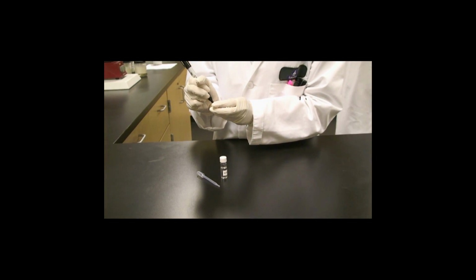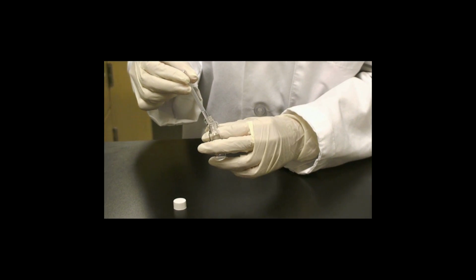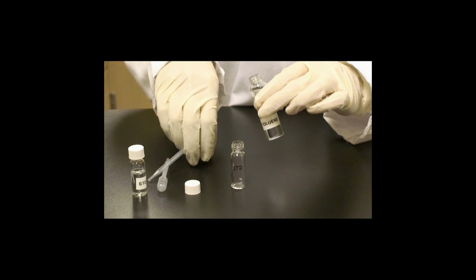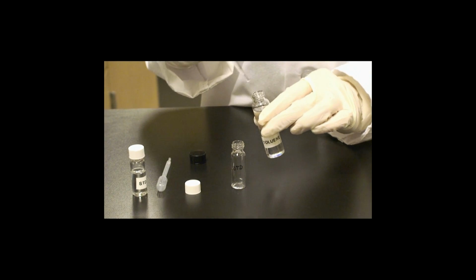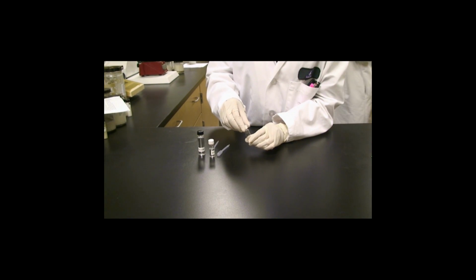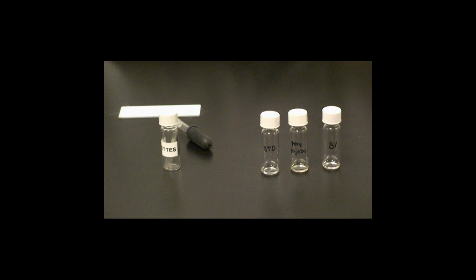Take a clean and empty vial and label it standard sample. Use a clean transfer pipette and place 1 drop of the standard into the vial marked standard sample. Then take a clean transfer pipette and add 3 drops of toluene into the same vial. Cap it and gently agitate to mix. Repeat this step for each of the samples to be tested, which in this case include all of your samples of jojoba in question, in addition to the 5% triglyceride sample.